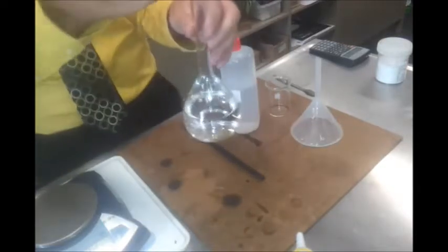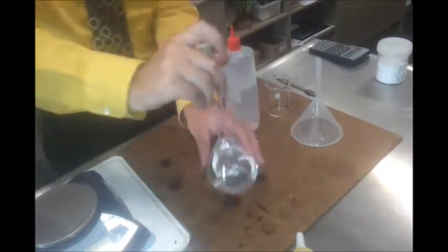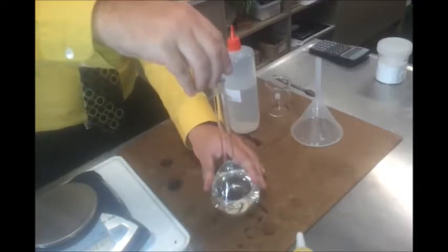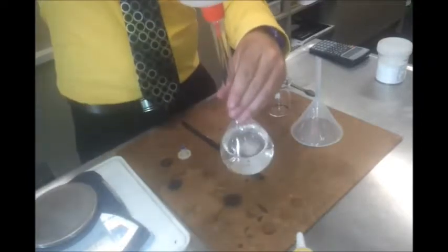See, there's still enough room for me to actually mix it. So it's worth doing if you notice any crystals have got through without dissolving. Alright, give it a few inversions to dissolve it. And then keep going.